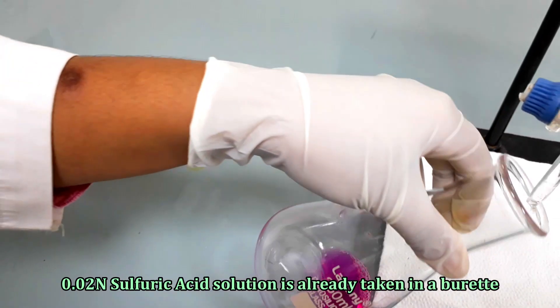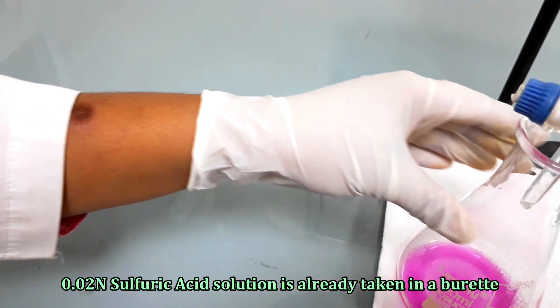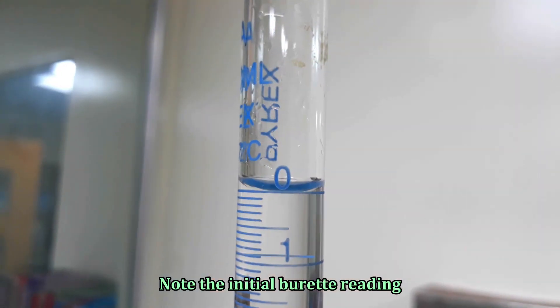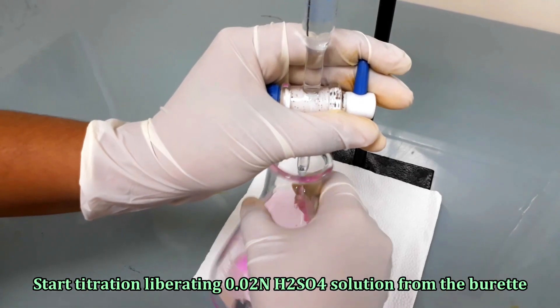The 0.02 normal sulfuric acid solution is already taken in a burette. Note the initial burette reading and start the titration, liberating 0.02 normal sulfuric acid solution from the burette.